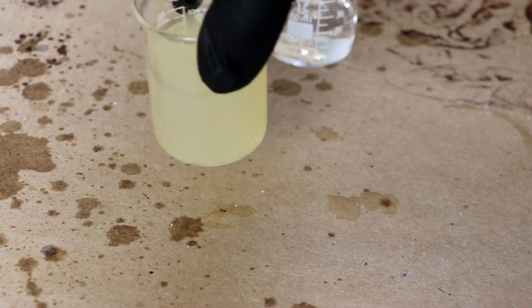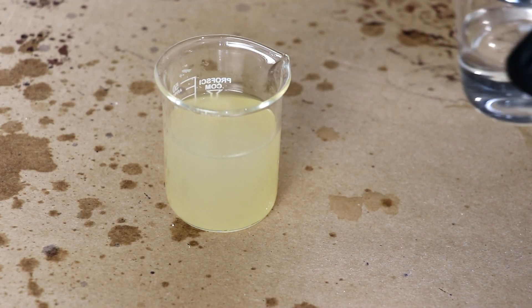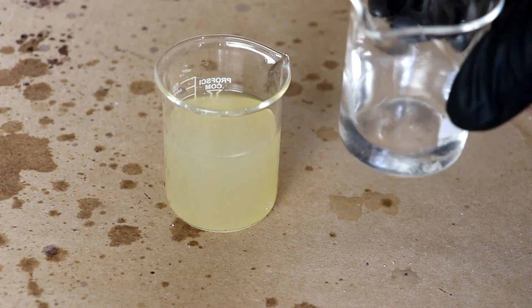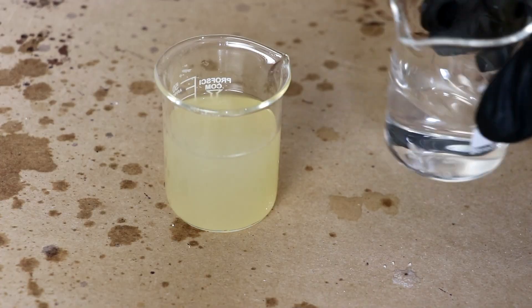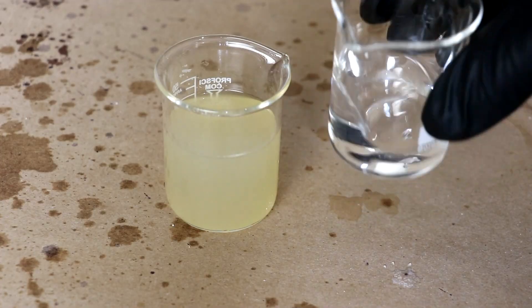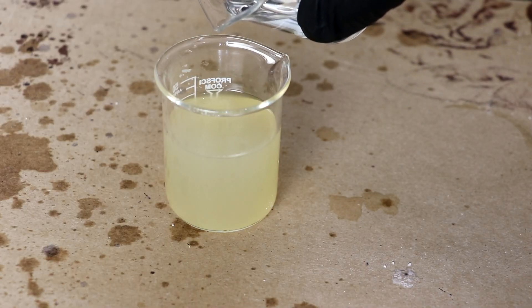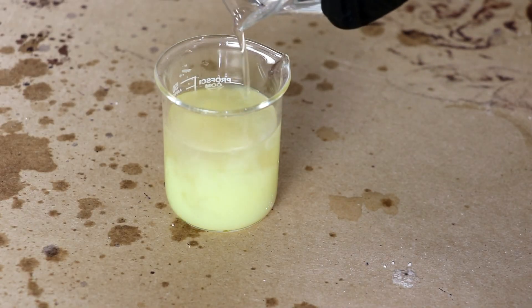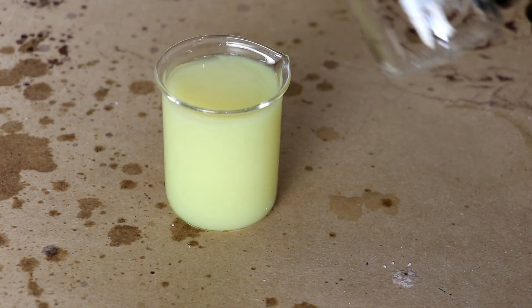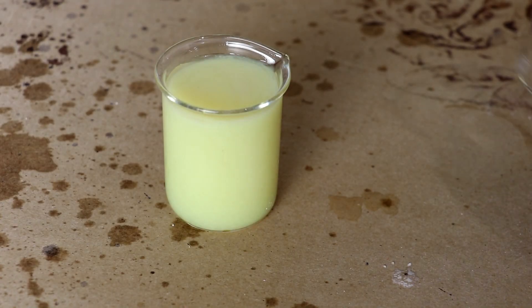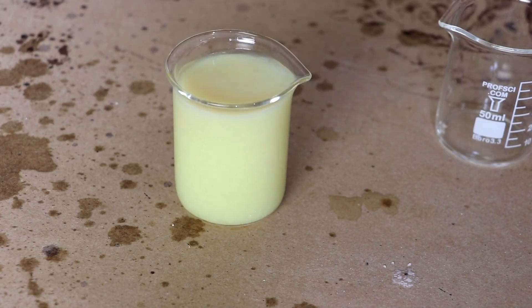Okay. The mixture's a little cloudy. That's probably not anything to worry about. So now I'm going to add a little bit of a silver nitrate solution. This is to precipitate all of the halides out of solution. It has silver chloride and silver iodide. Silver iodide is a nice yellow color. And you can see the yellow precipitant has formed. Excellent.